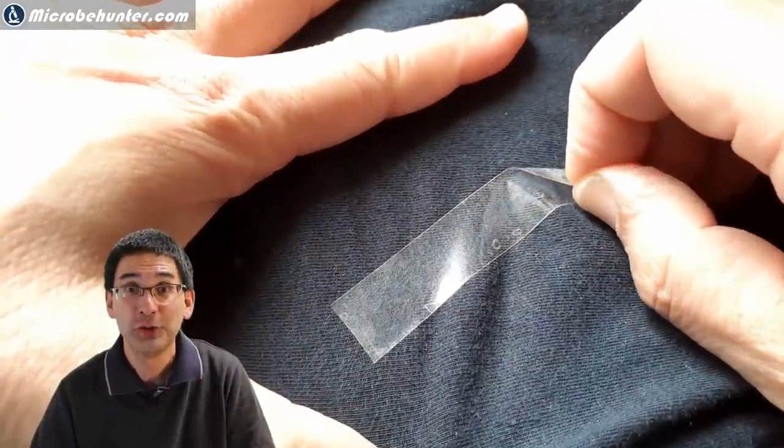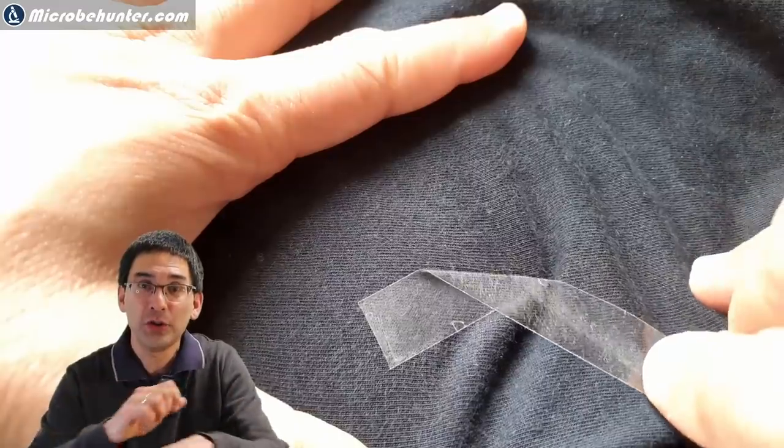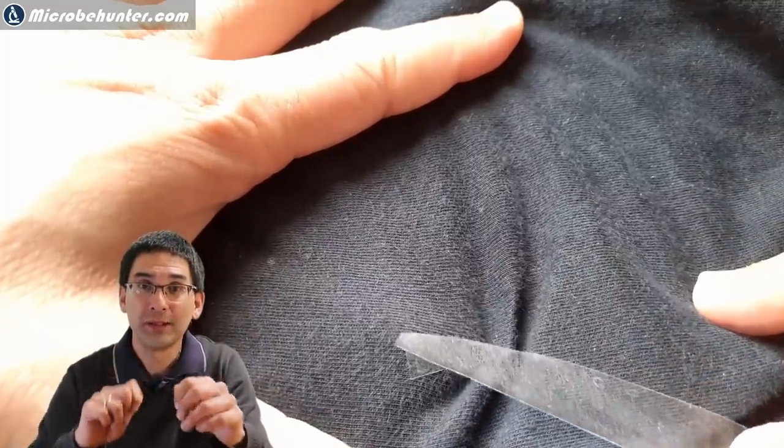Well this is all you have to do. This is how you collect those fibers. You put a piece of sticky tape on your t-shirt or your sweater and you peel it off.